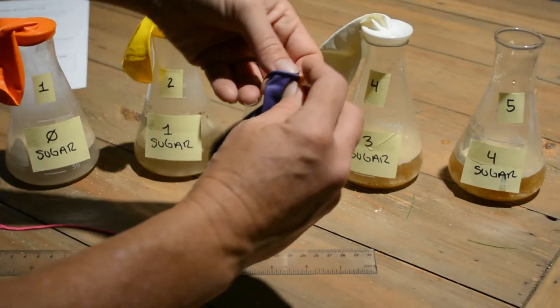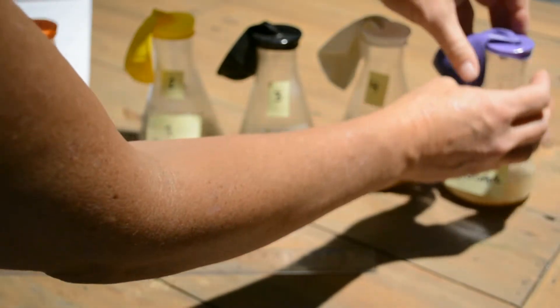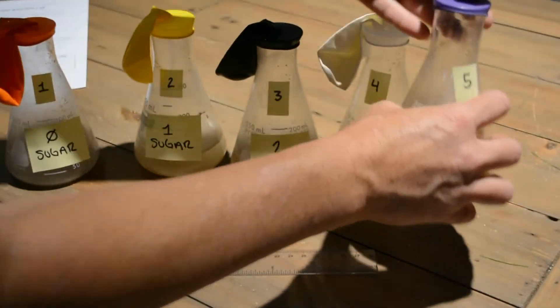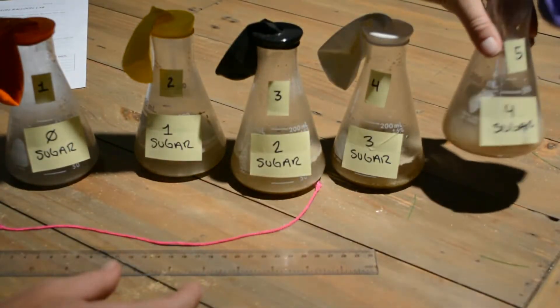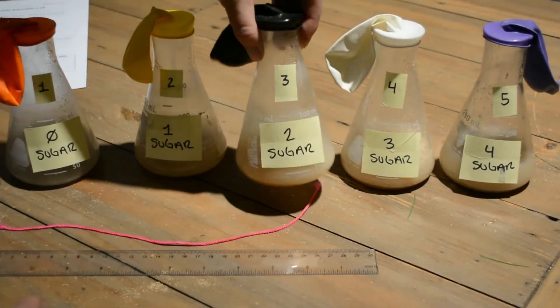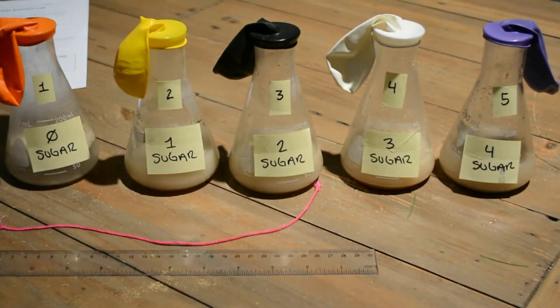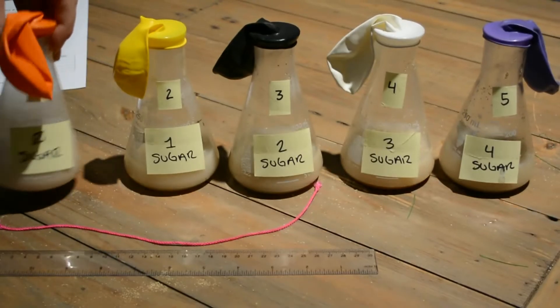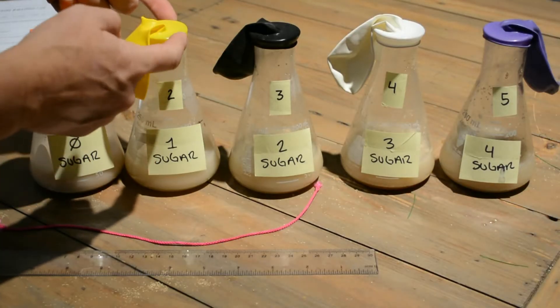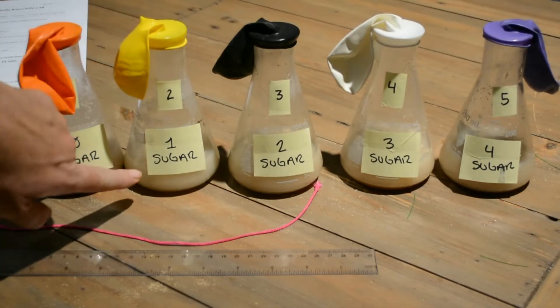The last balloon — we're going to cap off beaker number five. I'm placing the balloons so the opening is right in the middle, and then I vigorously swirl to activate the yeast inside the beakers to start breaking down the sugar. Remember, fermentation is the process of using sugar with no oxygen to create alcohol. By capping off the beaker, I'm allowing no oxygen in so the yeast can break down the sugar.